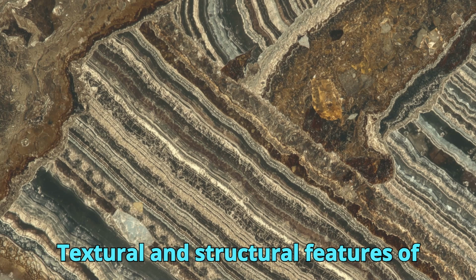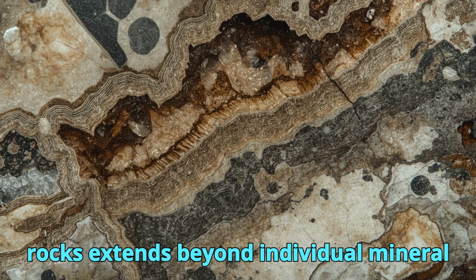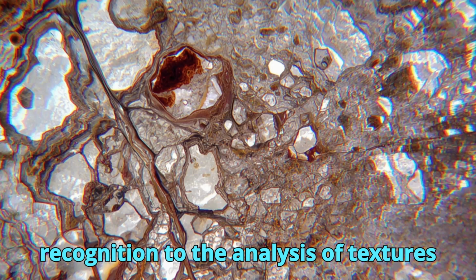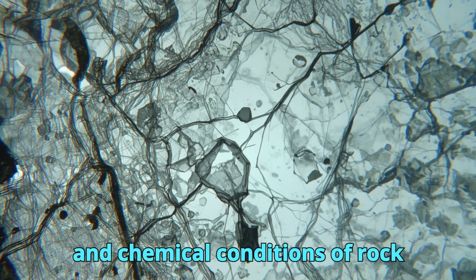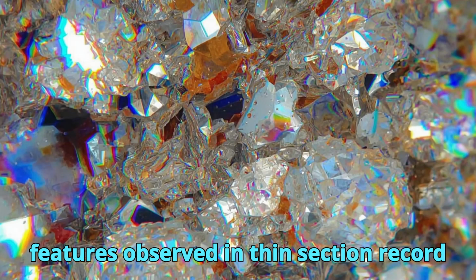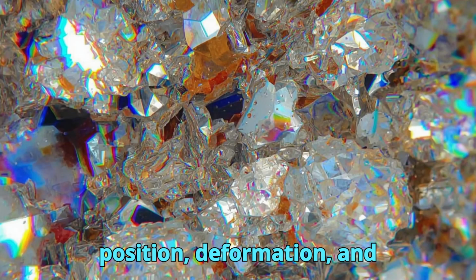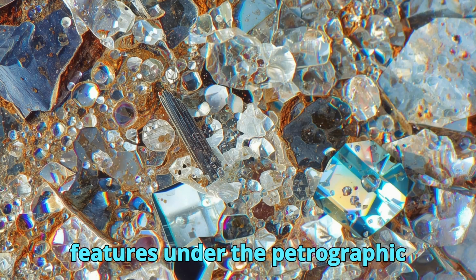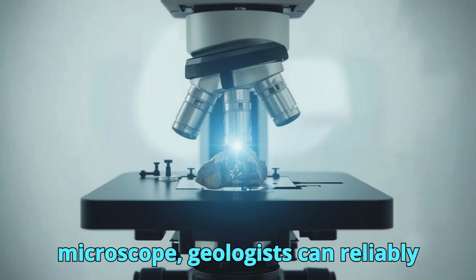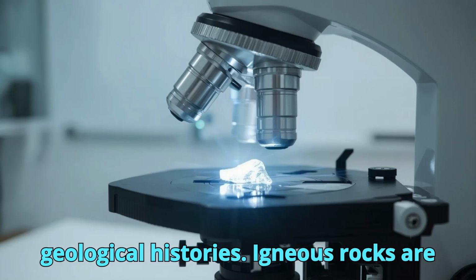Textural and structural features of igneous, sedimentary, and metamorphic rocks. The microscopic identification of rocks extends beyond individual mineral recognition to the analysis of textures and structures that reflect the physical and chemical conditions of rock formation. Textural and structural features observed in thin section record processes such as crystallization, deposition, deformation, and recrystallization. By examining these features under the petrographic microscope, geologists can reliably distinguish igneous, sedimentary, and metamorphic rocks and reconstruct their geological histories.